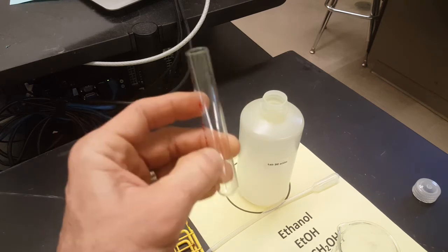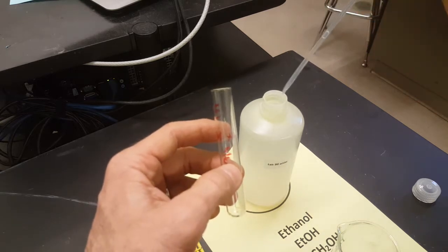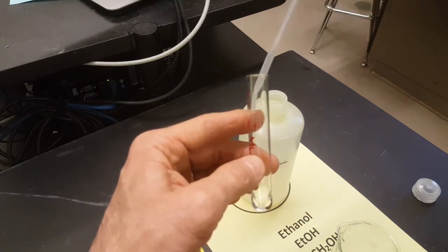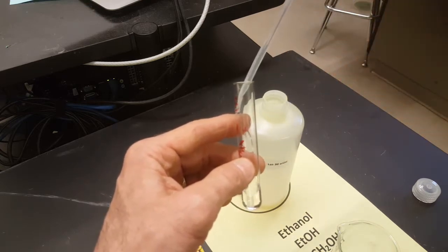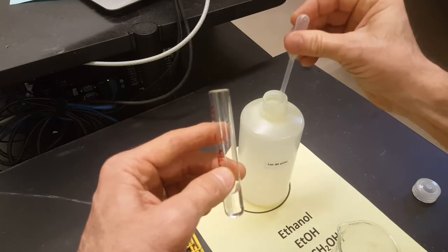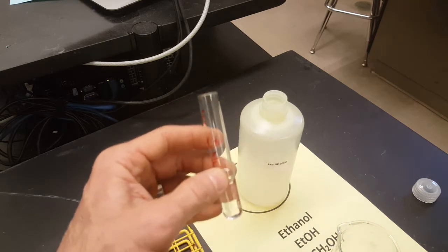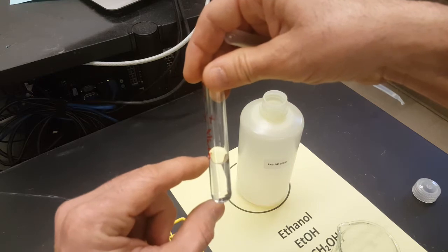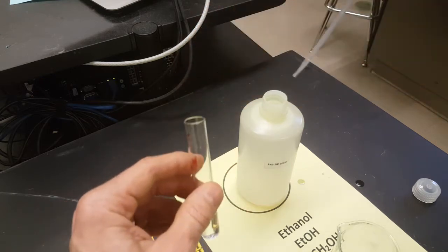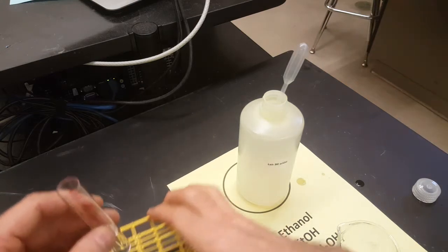You only need to do one trial for each alcohol. So we've given you these pipettes, and you don't have to do anything quantitative with the measuring of your alcohol today. You just need enough alcohol in here, in this case ethanol, so that your piece of paper gets entirely soaked. And so you need a column of alcohol that's as tall as the height of your paper. And so about 1 inch is good. You can put the dropper back into the resource bottle, put this back into your test tube rack, and take it back to your lab bench.